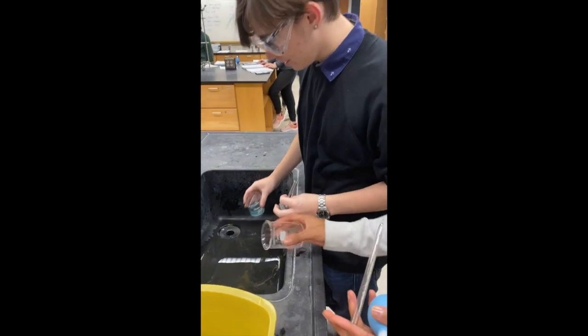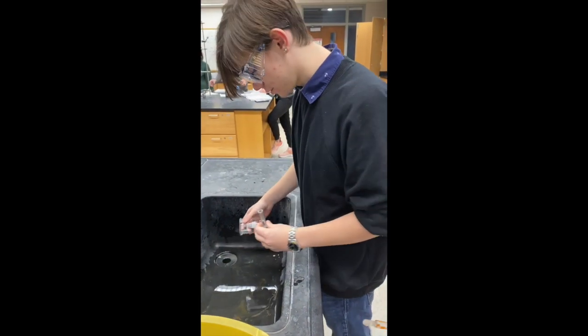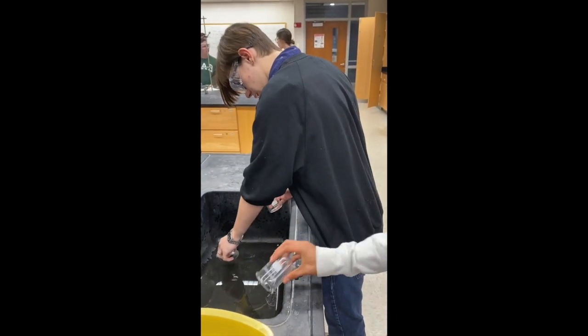After the lab experiment, you want to make sure you properly dispose of all of your solutions. And take care.